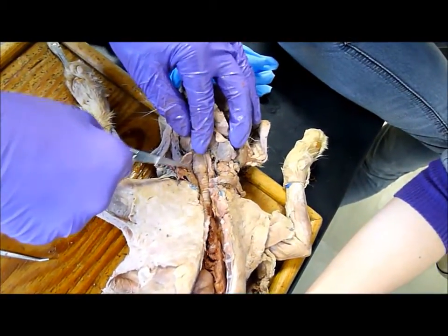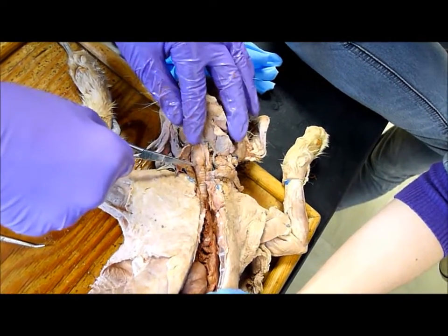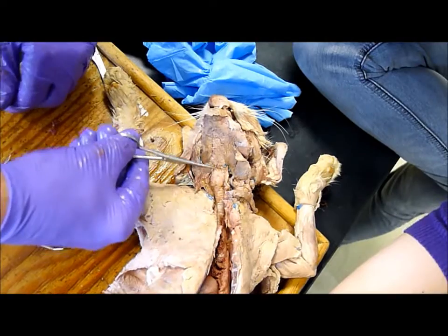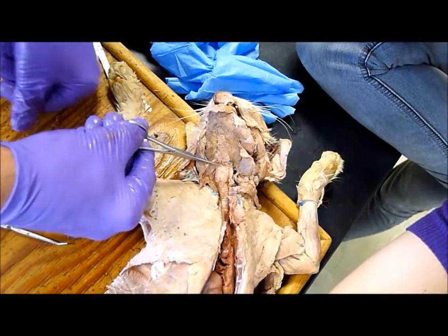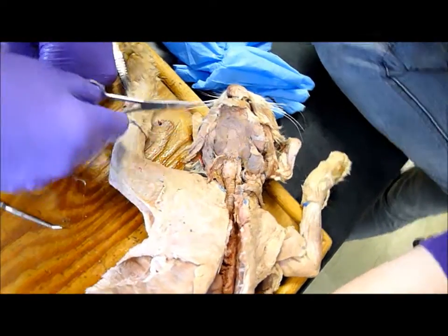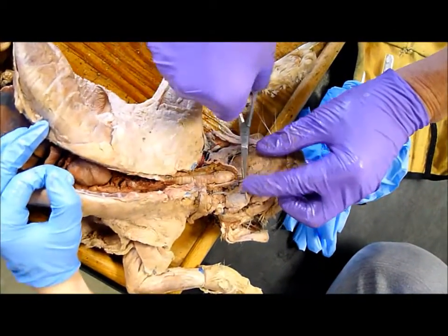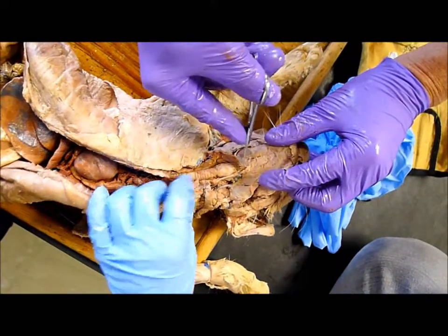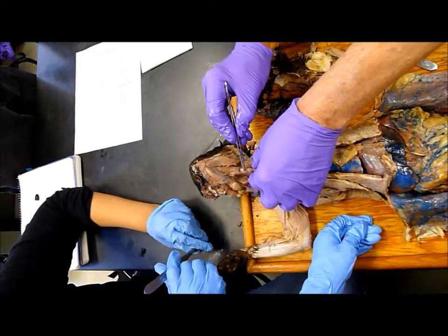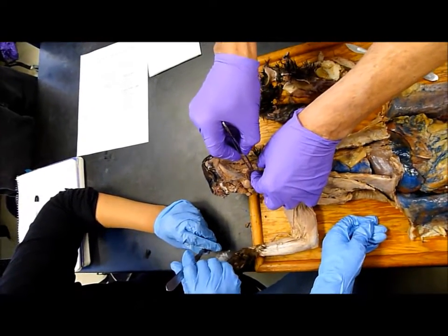It's probably about from there to there. We thought that was just the larynx. Well, it's the larynx, but the cartilage making up the larynx — one of them is the thyroid cartilage. And then above it is going to be the hyoid bone, the laryngeal prominence, Adam's apple — and there's the hyoid bone right there.